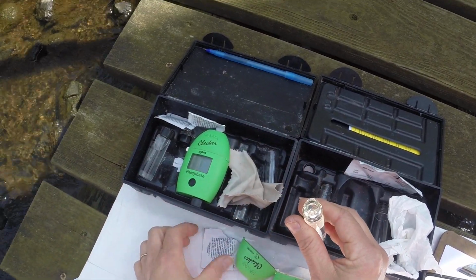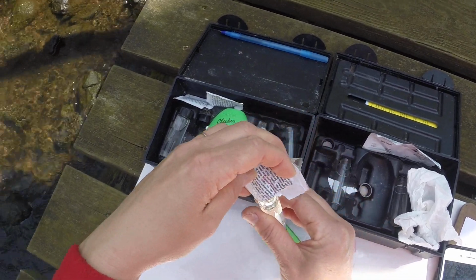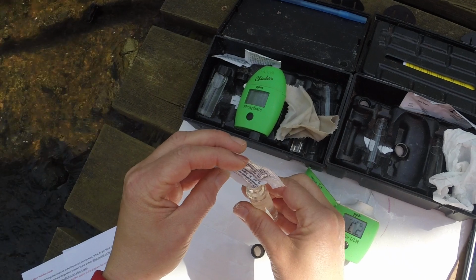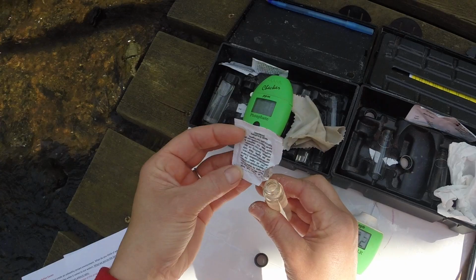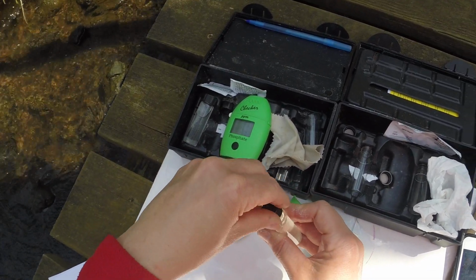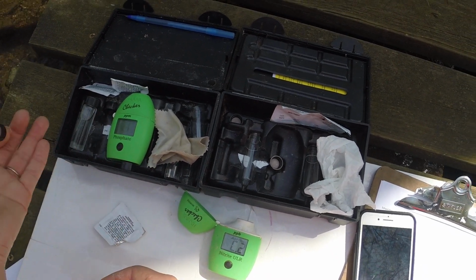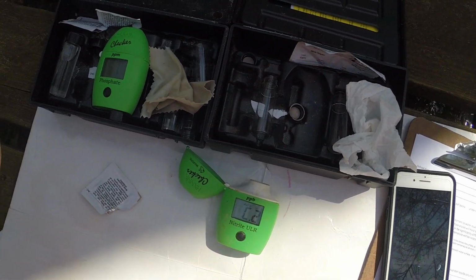So, I'm going to do this over my paper I have here, so we have nothing going in the water. And I will clean my hands and the instruments later on. So I've got the sample in there, and I need to mix it. I have about 2 minutes till that meter goes off.